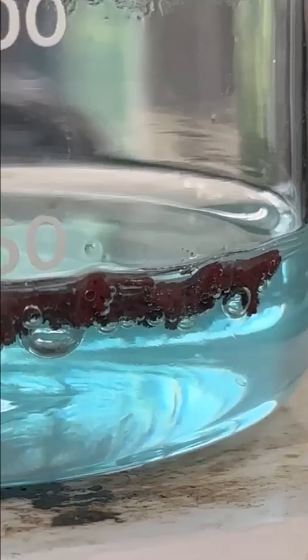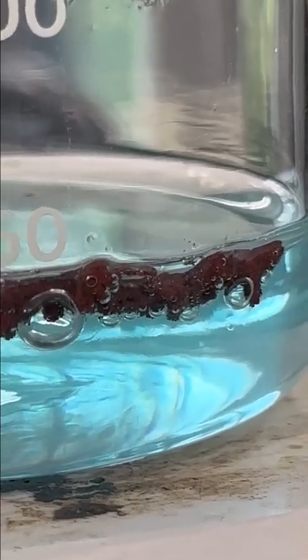So I'm going to go ahead and turn on the stir bar again and let this reaction go to completion. And how do I know when it's complete? Right now you can see that blue color still in the solution. The blue color is the copper. So once this reaction is complete, there should be no more blue color in the solution. It should all be that solid spongy red color that's forming on the surface of the aluminum foil.